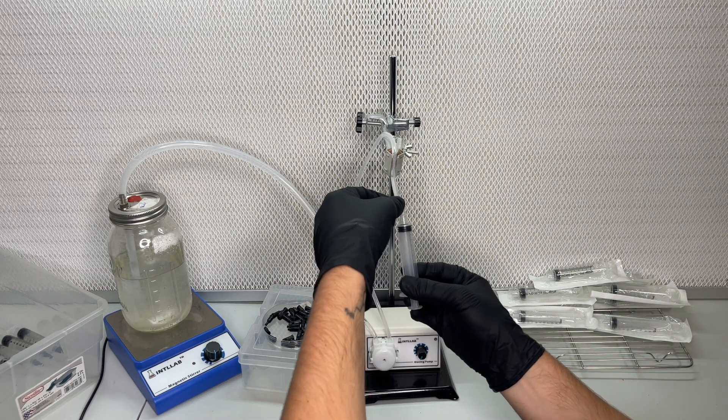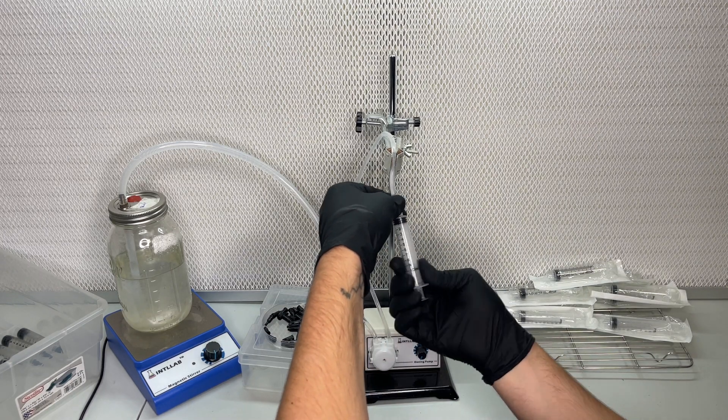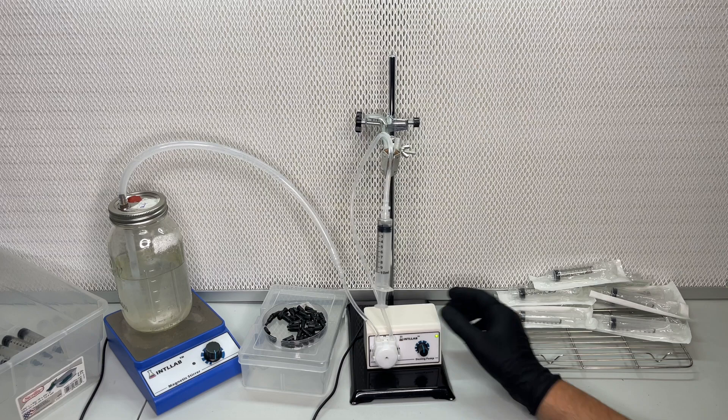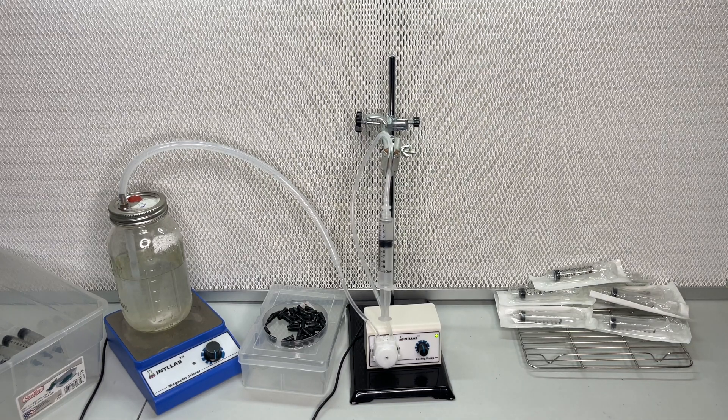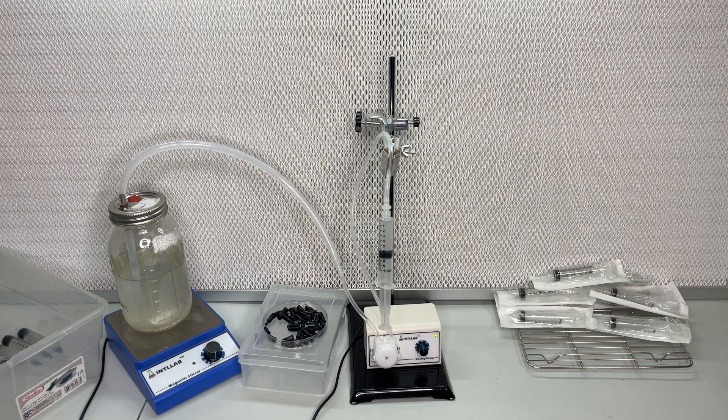I also experimented with adding more than one luer lock adapter to the end of the tubing to try to fill up more than one syringe at a time, but it seemed to not work as good when you do more than one syringe.